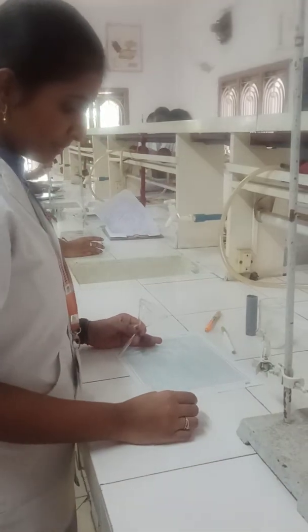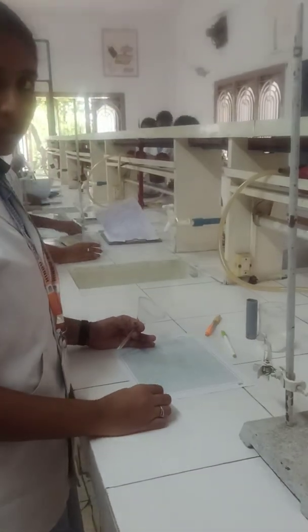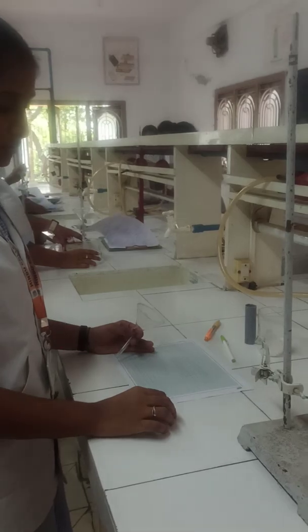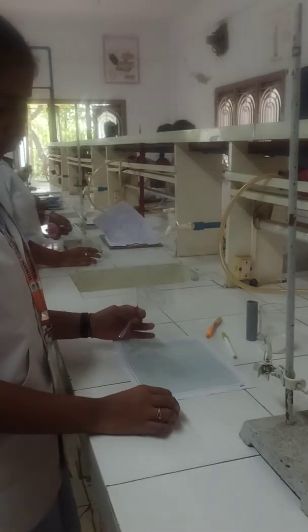Today we are going to do the experiment on determination of angle of repose by the fixed funnel method.